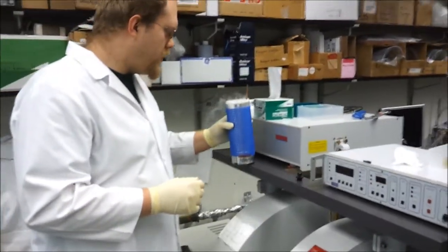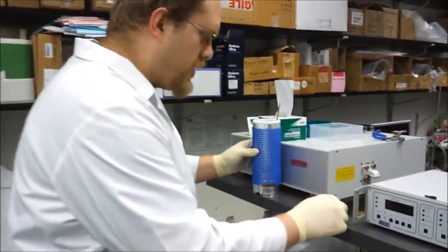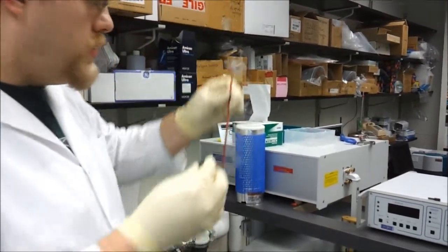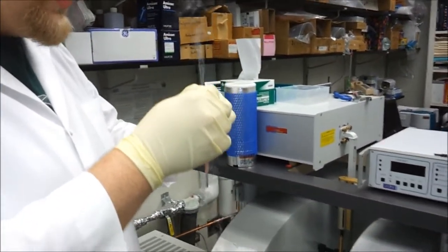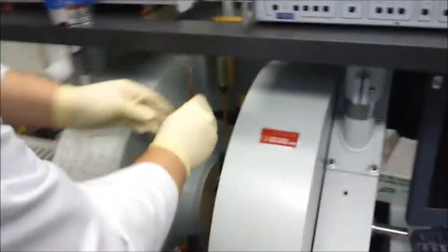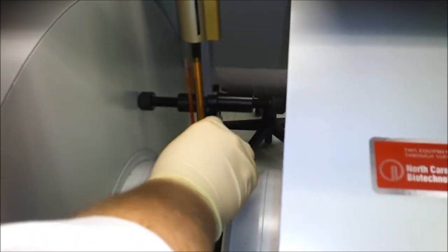If you're curious about how we actually, what we actually do with it once we get the sample, we just take it out, put it in this little collar here, and stick this down inside the spectrometer, right like that.